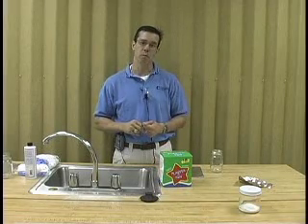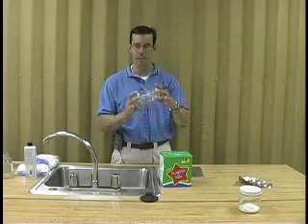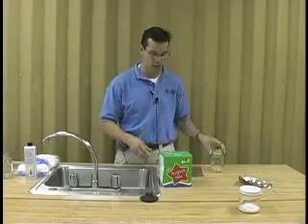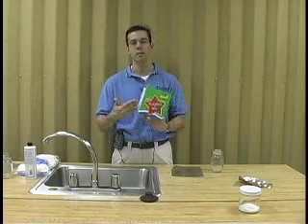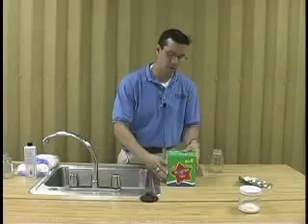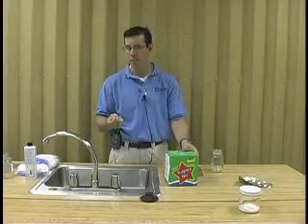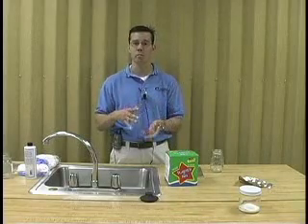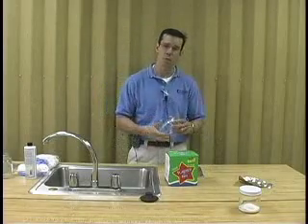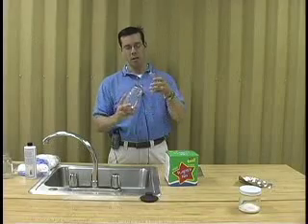A second method that can be employed is the construction of a kill jar. Kill jars are easy to make. All you need is a mason jar, such as you see here, and a plaster of Paris kit that can be purchased at a retail store. Basically, you want to mix your plaster of Paris, and try to mix in maybe a half handful of sawdust. What this will do is allow the killing agent to permeate the plaster of Paris once it's dried.